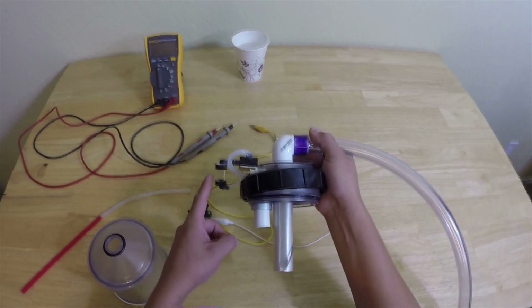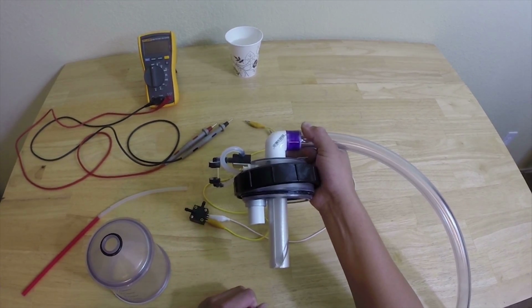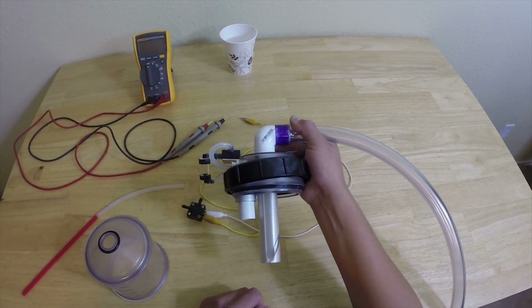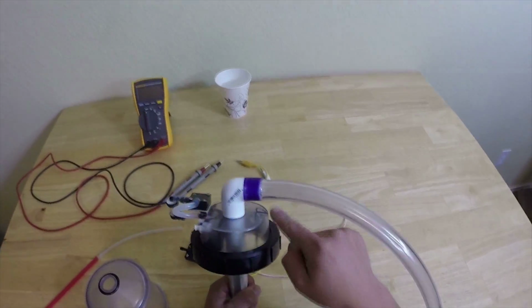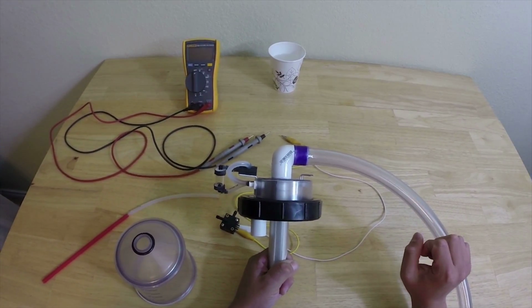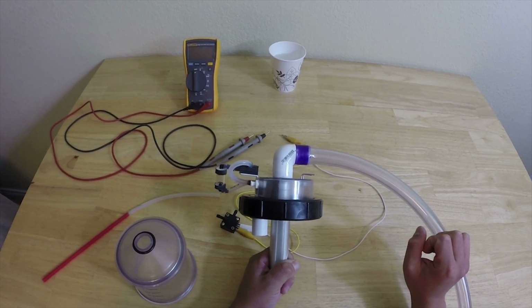A water trap is provided to prevent water from reaching the pressure switch and is on the low side. If water is present, it should always be emptied. A second set of 3/16 stainless steel probes, which normally do not contact the water, act as backup. If the pressure switch should fail for any reason, these probes will complete the sample. But you should avoid running off the backup probes because if they fail, water can enter the air system.